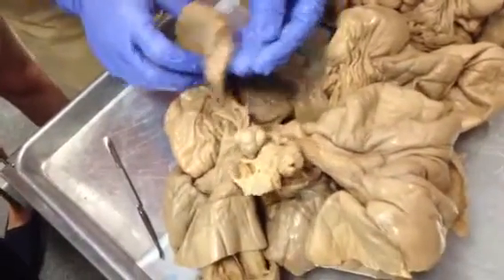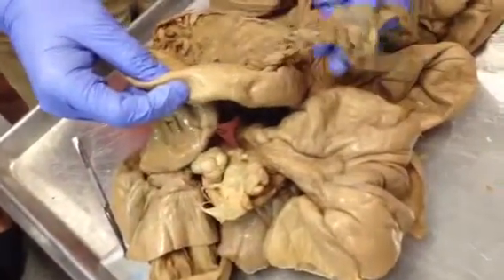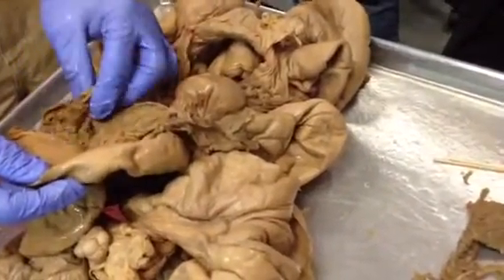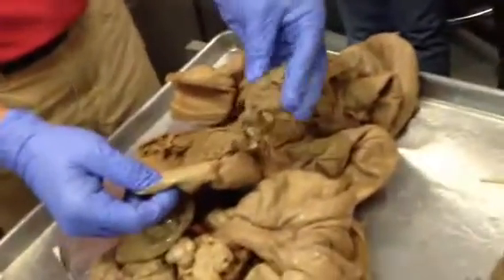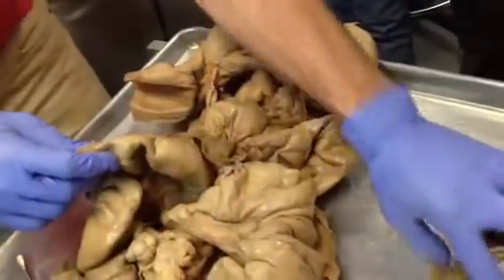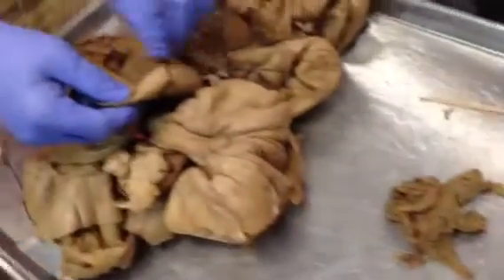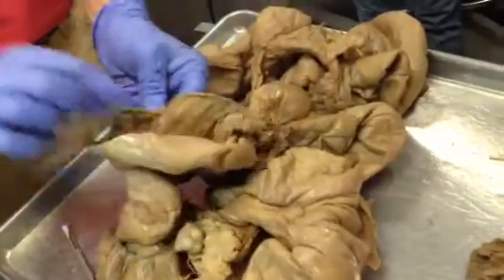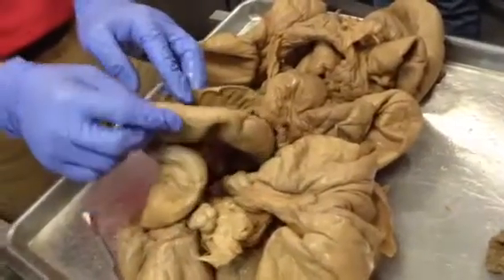Okay. Now, the perimetrium, the myometrium, and the placenta. Not to be confused with endometrium. This is the endometrium in the middle. Sorry, thinking out loud. The placenta looks like endometrium, but it hangs out, and there's some placenta there. If I put a pin through this, it'd be placenta. If I just put a pin through that endometrium, it would be endometrium. Okay, so that's where students have trouble.